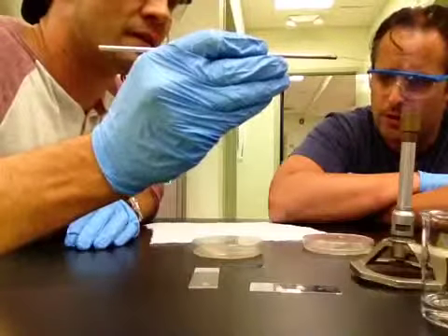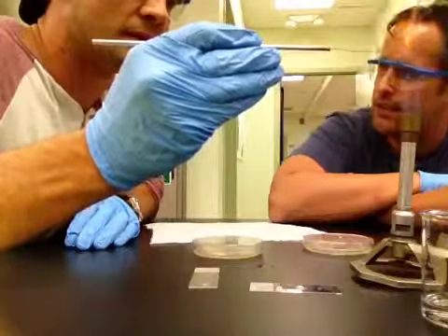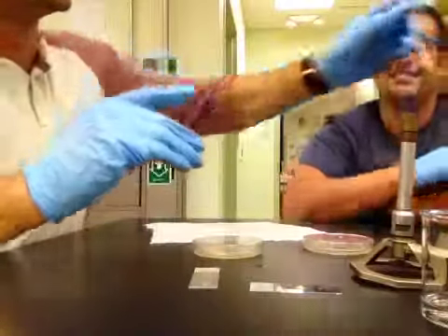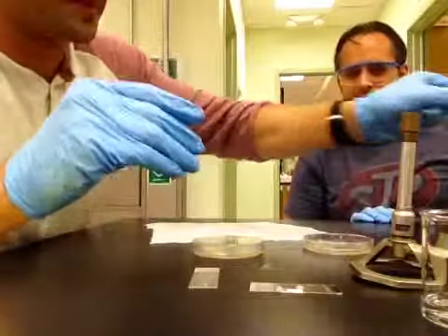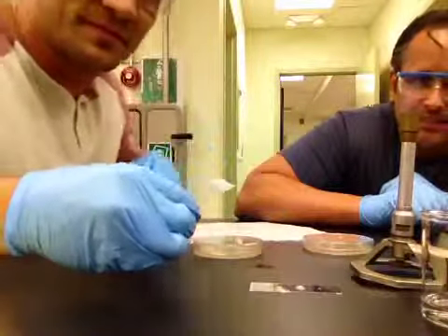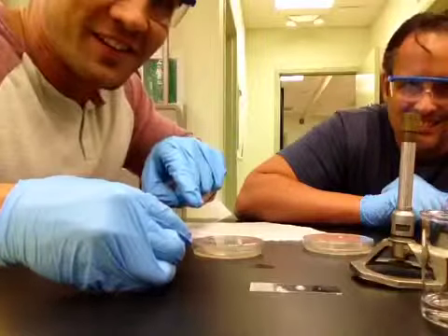Okay. Rich, why don't you pick up that slide and show it to the camera so they can see the E. coli? Brian, that's a great idea. E. coli on the slide.